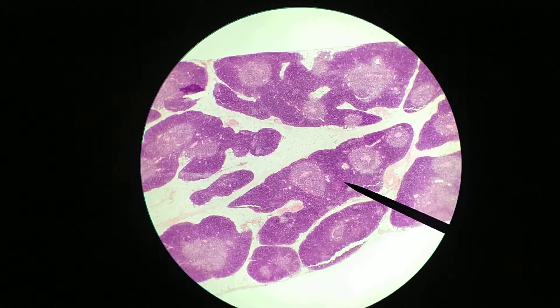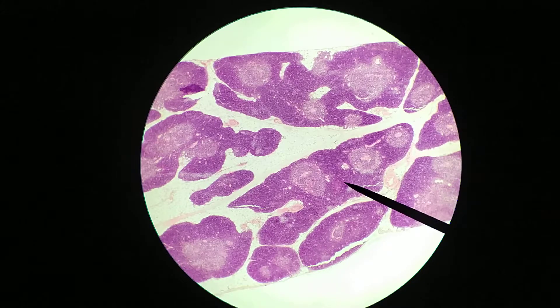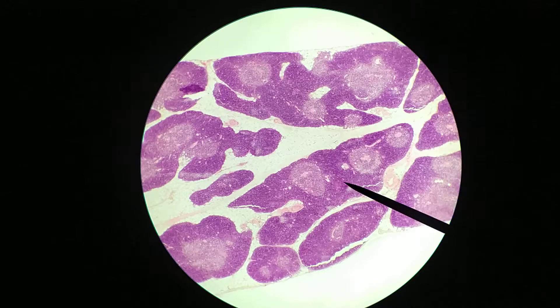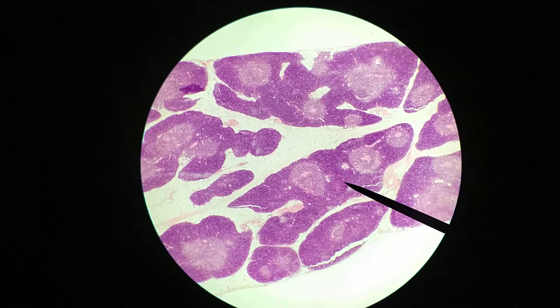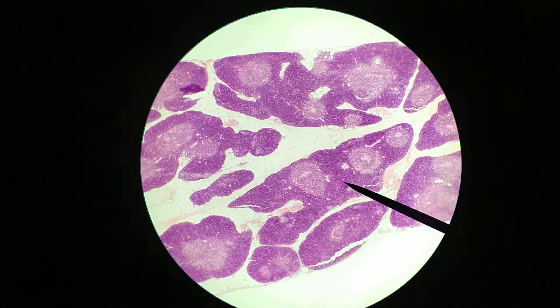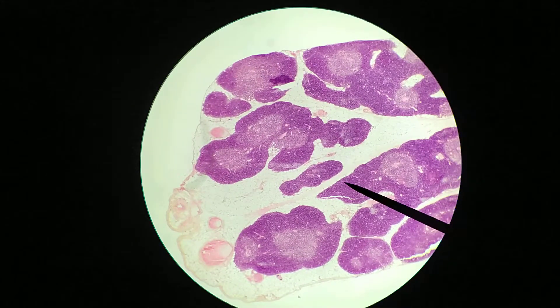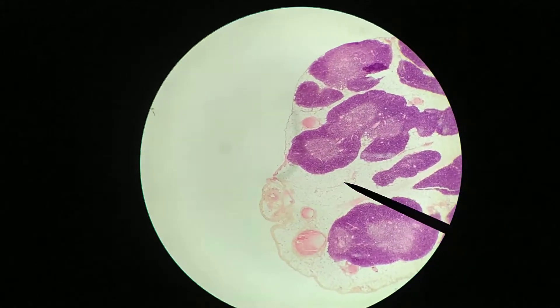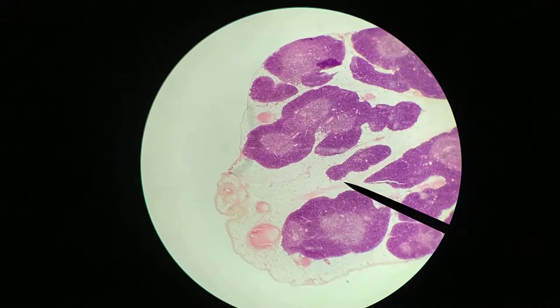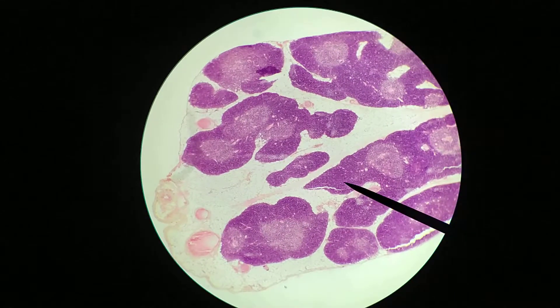Hi everyone. In this video we're going to be looking at a slide of the thymus. Now this is not a very young thymus — it's actually a relatively mature thymus, well not fully mature but pretty close to it. What you're actually seeing here is something going on that is removing some of the lymphatic tissue and replacing it with fat. This is a process called involution. Instead, I want to give you an idea of the overall structure of this organ.